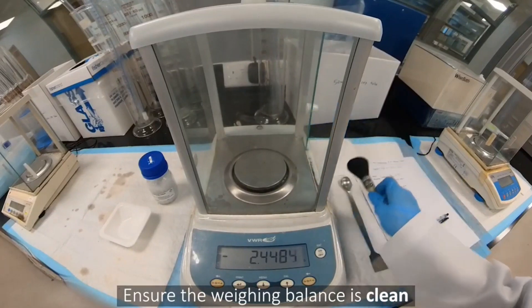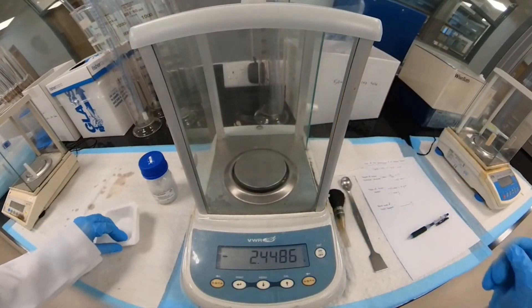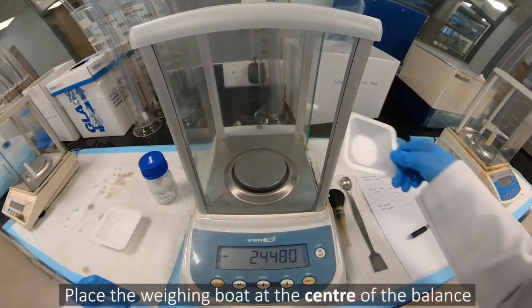Ensure the weighing balance is clean. Place the weighing boat at the center of the balance.